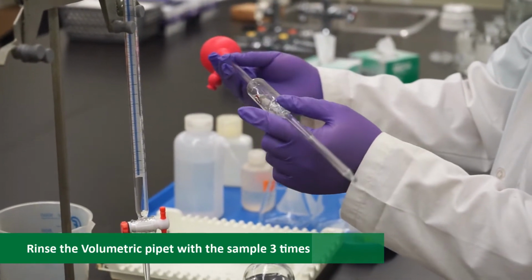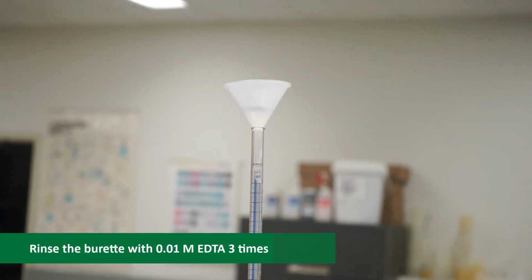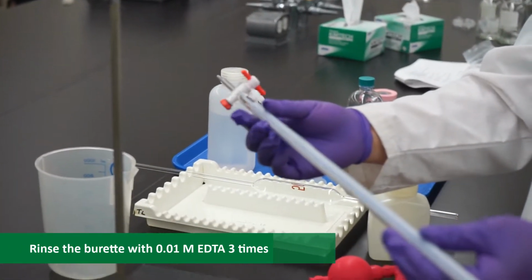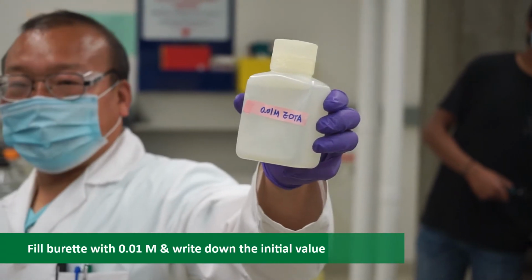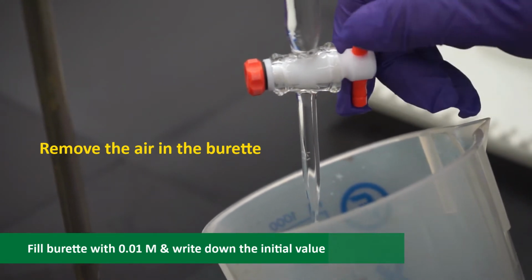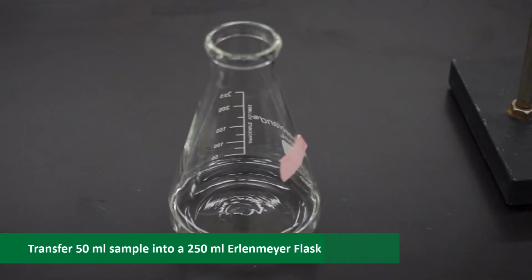In order to begin, start by rinsing the volumetric pipette with the sample 3 times. Then follow with rinsing the burette with 0.01 molar EDTA 3 times. At this point, fill the burette with 0.01 molar EDTA and write down the initial volume. Take a 50 ml sample and transfer it into a 250 ml Erlenmeyer flask.